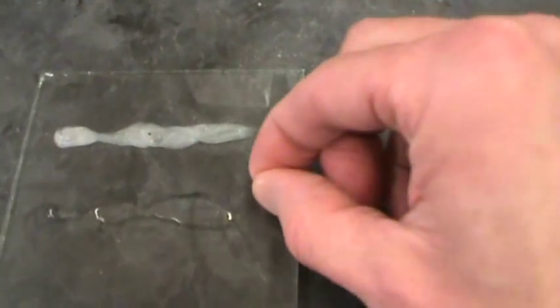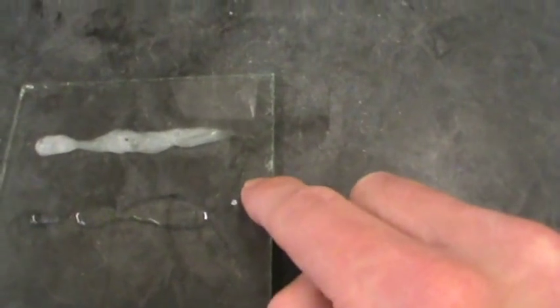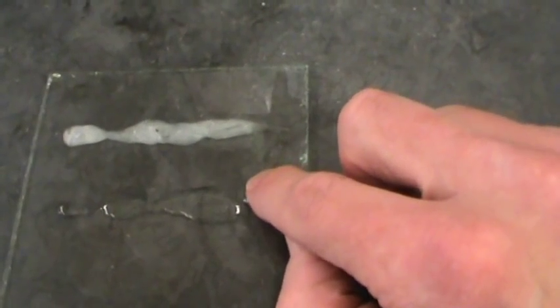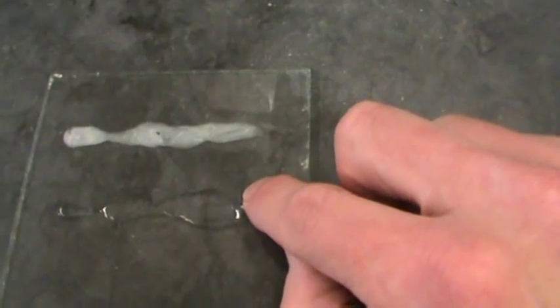In the bottom case, what I'm going to have to do, probably, is add a little seed crystal. See it right there on the side? That's a crystal of sodium acetate. I'm just going to push that in so that they're touching, so that the seed crystal touches the supersaturated solution. And sure enough, you get the crystallization of the sodium acetate out of the supersaturated solution.